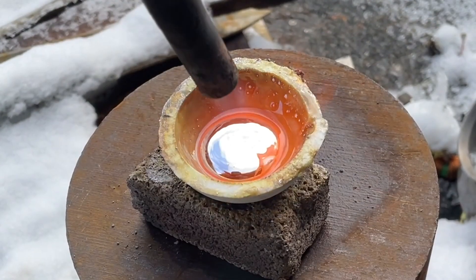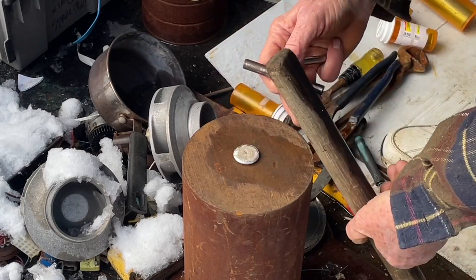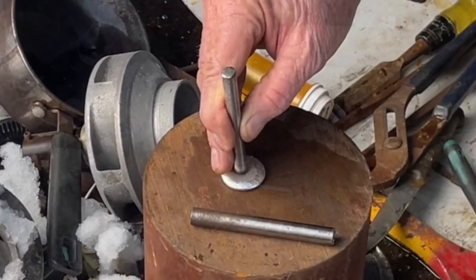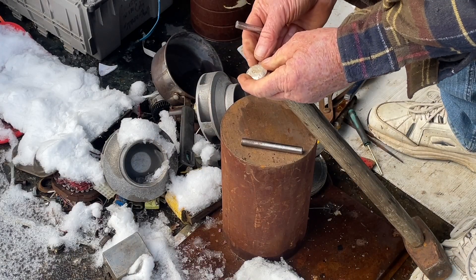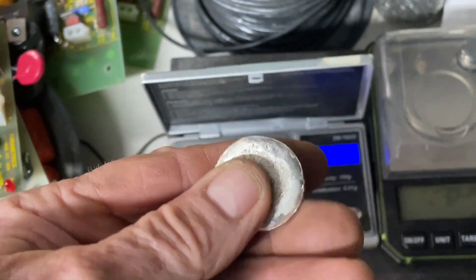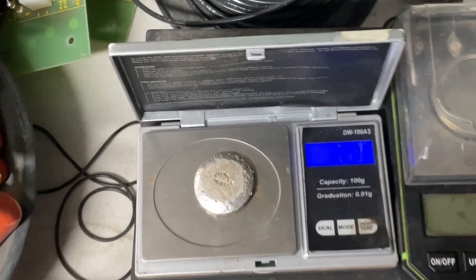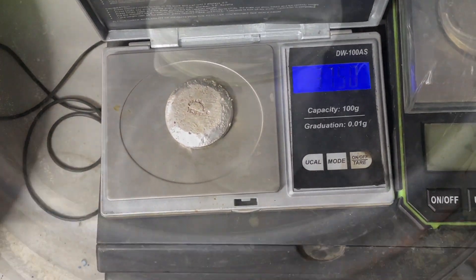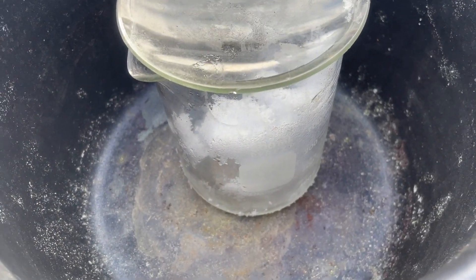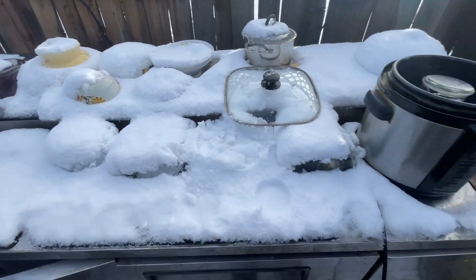Try to pack it all in. See how that comes — see how you can tell when you take the top off. Okay folks, this was 11 something or other, so 11 times 4 is 44... yeah, 37.5 is probably enough. We're going to get down to some pure gold — snow gold. We got snow gold everywhere right there.